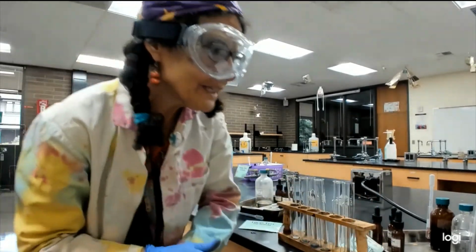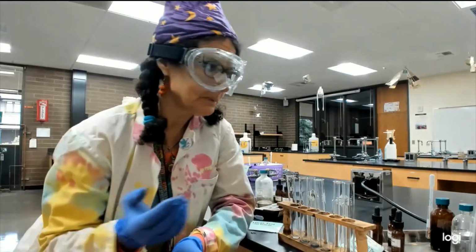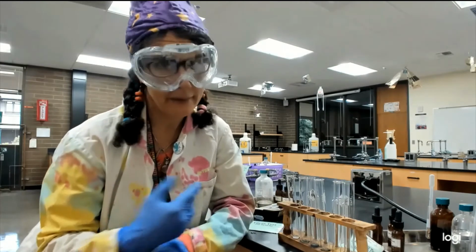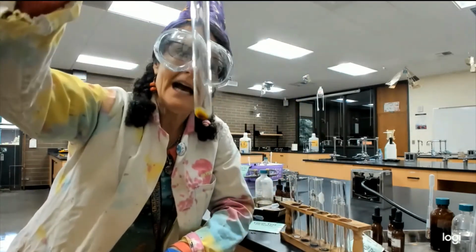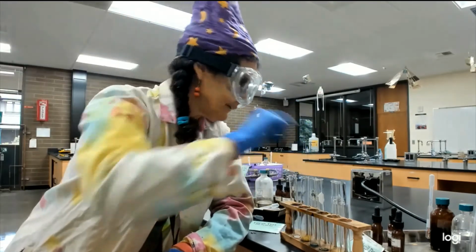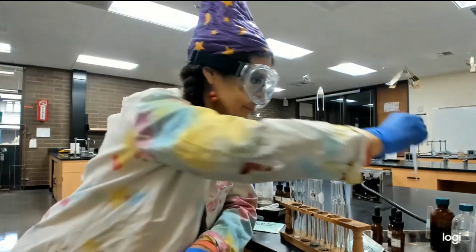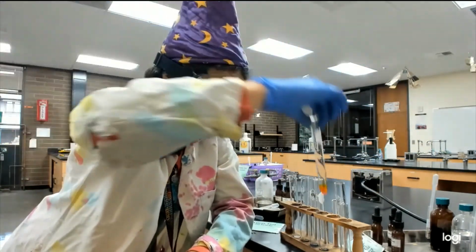So we did what's called the Bordwell-Wellman test. So Mr. Bordwell and Mr. Wellman. Definitely it's probably a Mr. because they ain't let women in the lab. We can kind of see why today, can't we? So this was our, the stuff that we add is orange. You can see that in here. So if something turns orange, it means nothing happened.